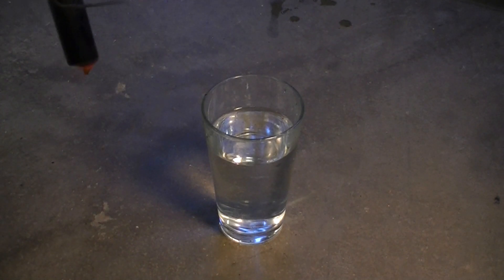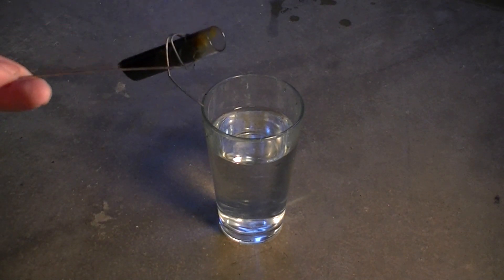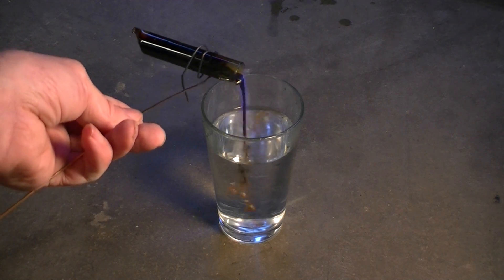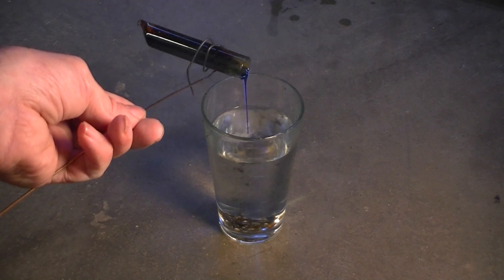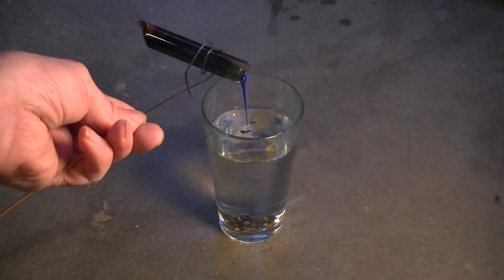Once we have melted our sulfur and taken it near to the boiling point, we now quench this in water. And the rapid cooling freezes the sulfur into an amorphous state.